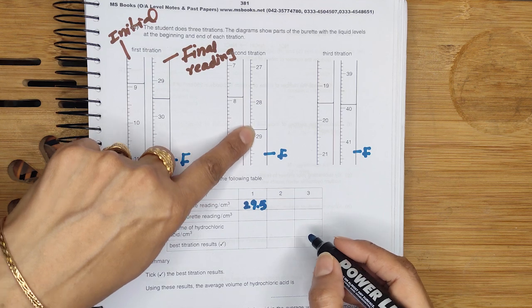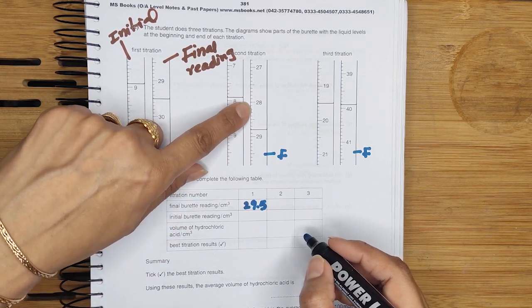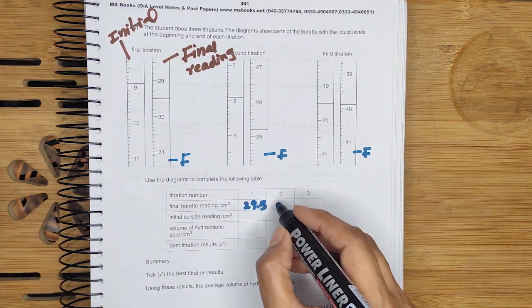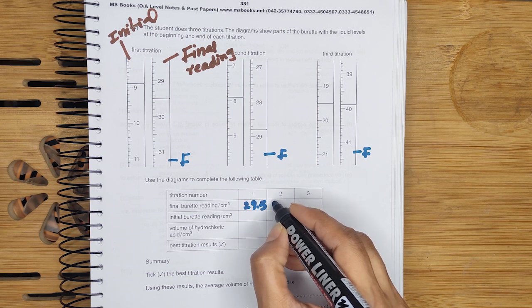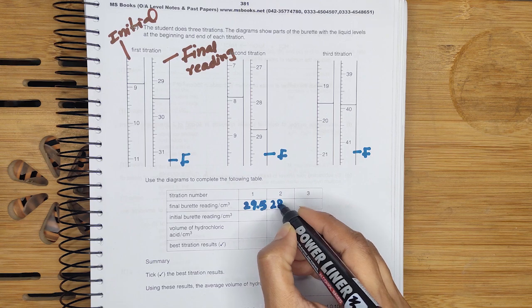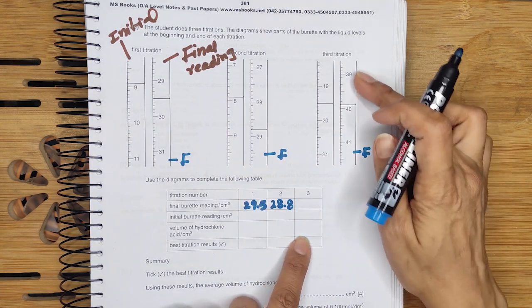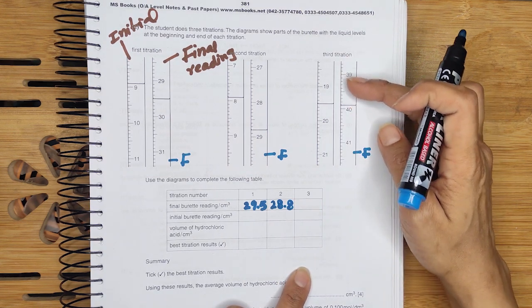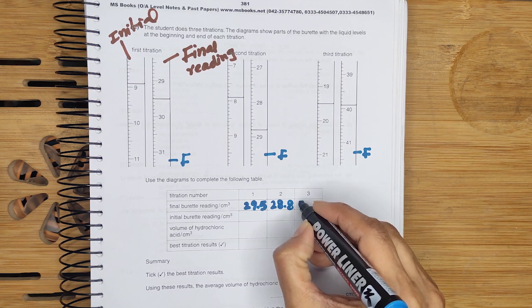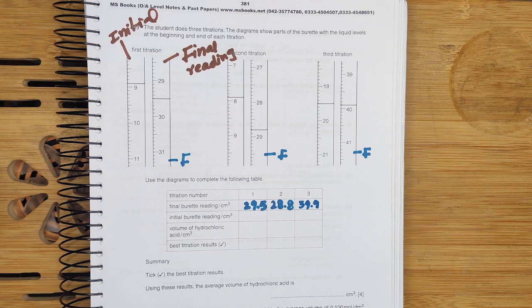Now for the second titration value: 28.1, 2, 3, 4, 5, 6, 7, 8 — so it ends at 28.8. The final reading of the third titration is 39.9. So in the final burette reading row we write 29.5, 28.8, and 39.9.